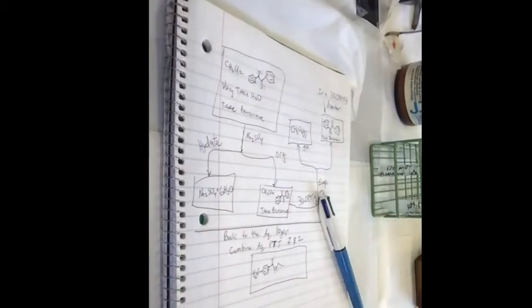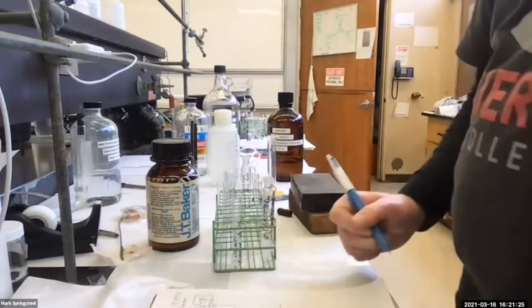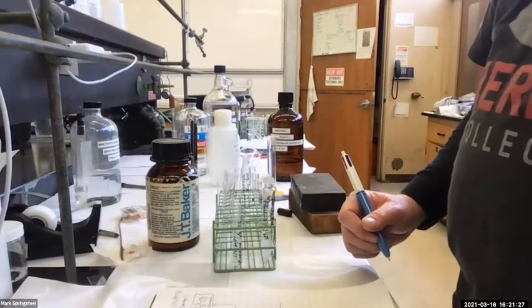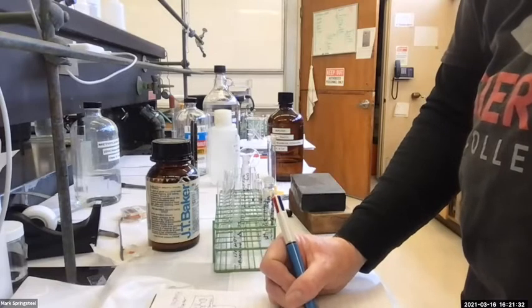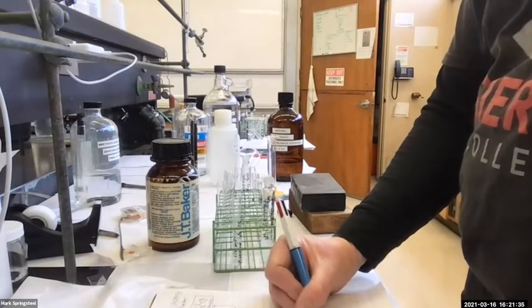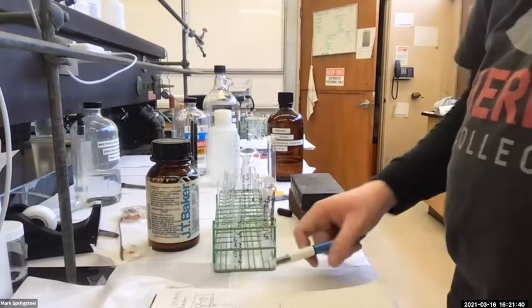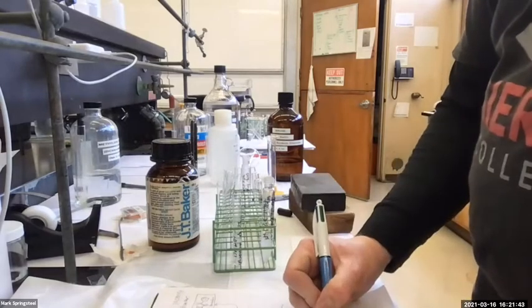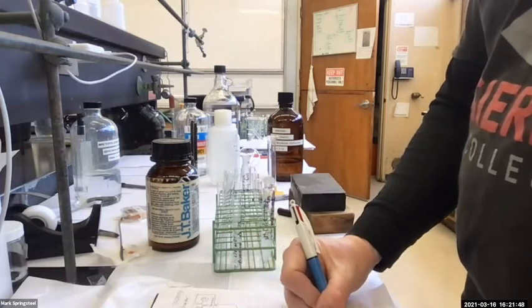And what else is in here besides benzocaine? Can you ever remember? Water. All right, good. So benzocaine, water, yes, mostly water. And what else? Sodium. Yes, sodium. Chloride. Chloride from when it was acidic, but now it's basic, so hydroxide, right? So how can I extract this precipitate out of this organic or aqueous layer?